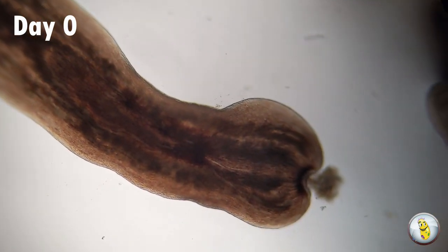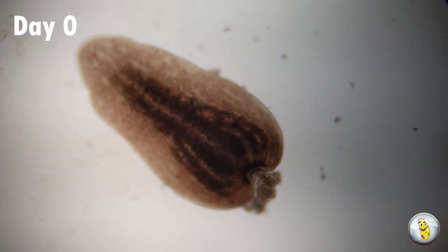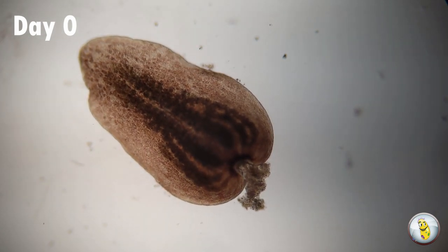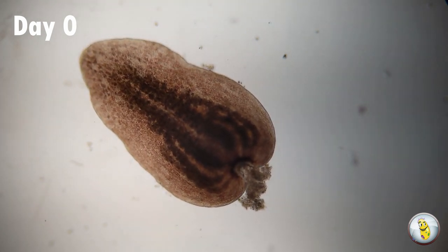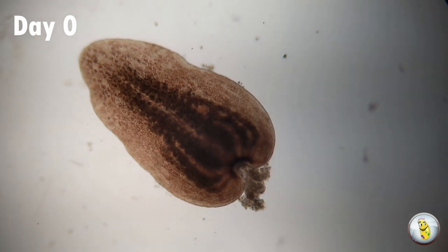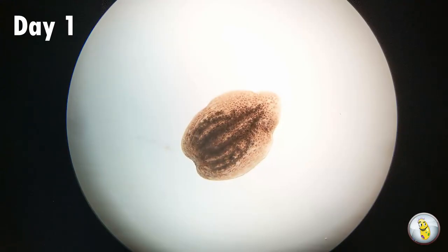Obviously, the middle part doesn't have a head and it doesn't have a tail. And the tail, as we can see here, has no head, really no digestive system, no way to see or take in food. So I wanted to see what would happen as the days went by.